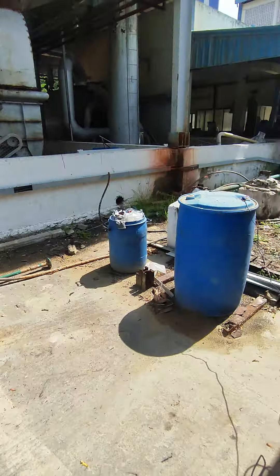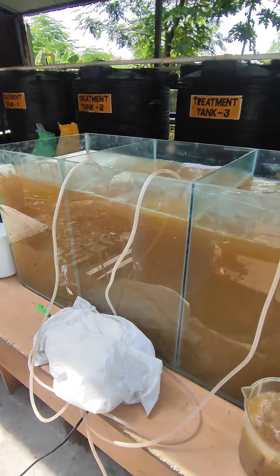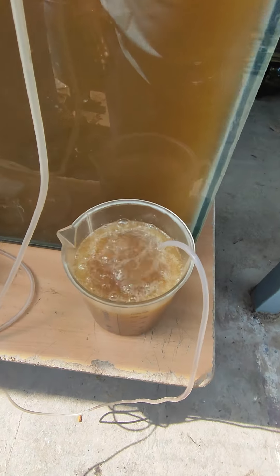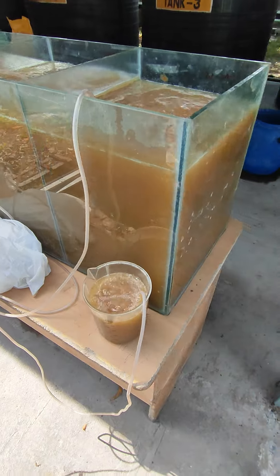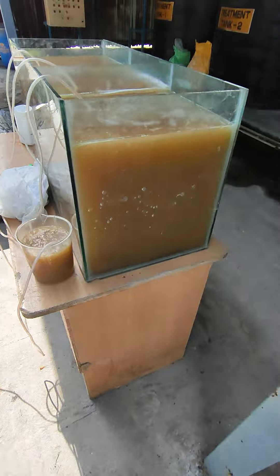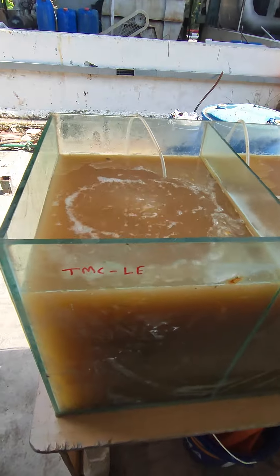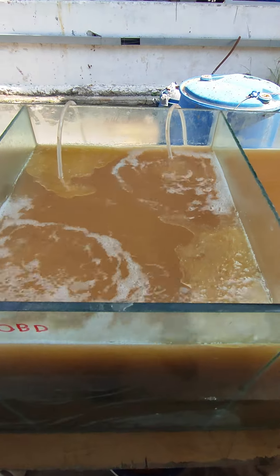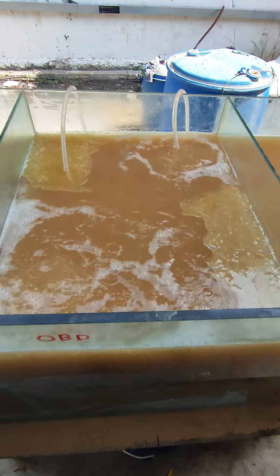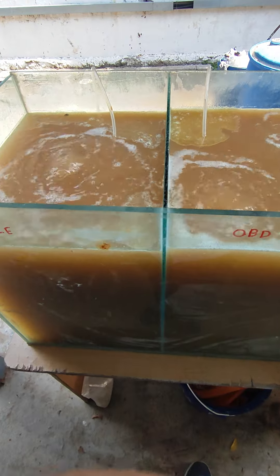We are going to reduce the oil and grease in wastewater. This is a pilot plant. In this tank, we are going to fill an industrial effluent. We are going to load the oil at 1,000 ppm. This is a vegetable oil.